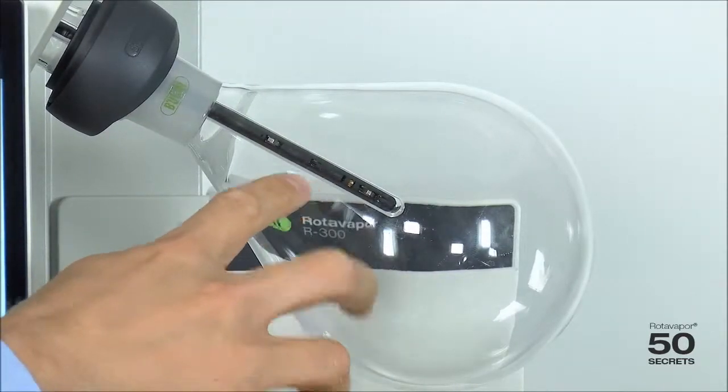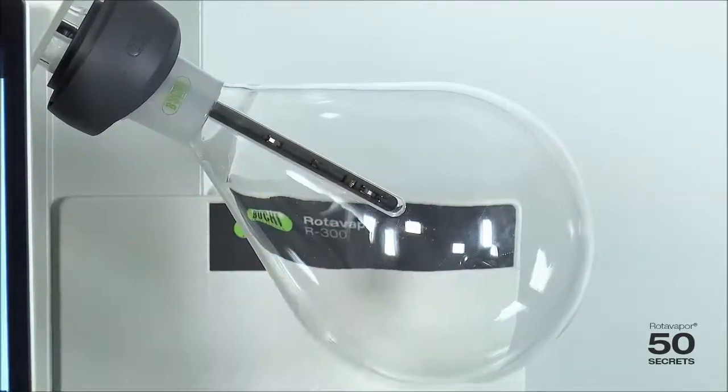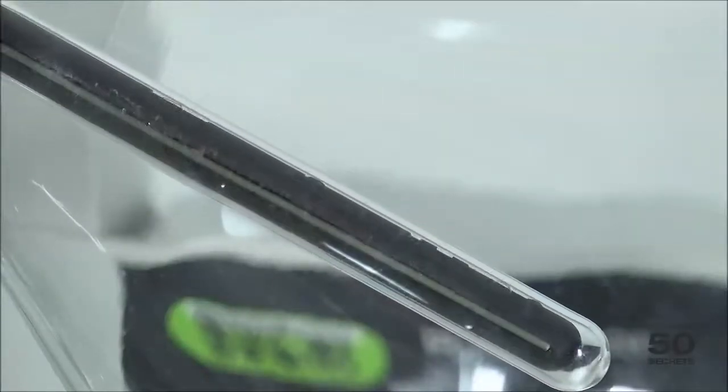In addition, it's very important to adjust these two silver stripes to the horizontal level like this and not like that.